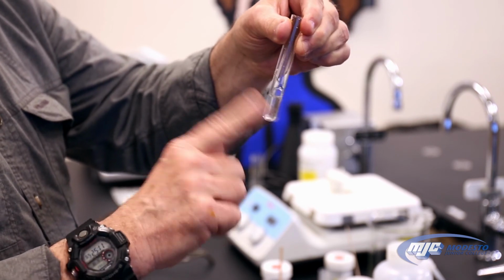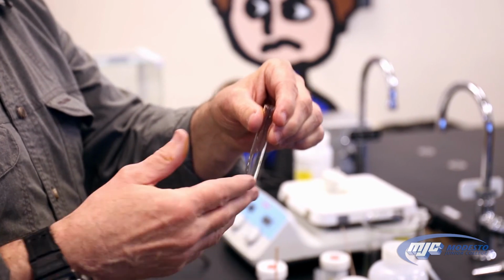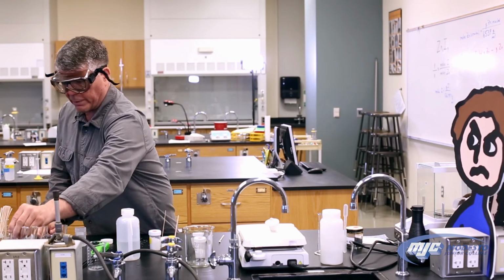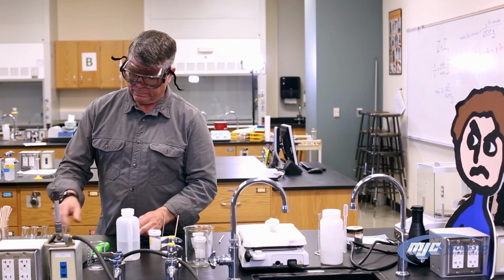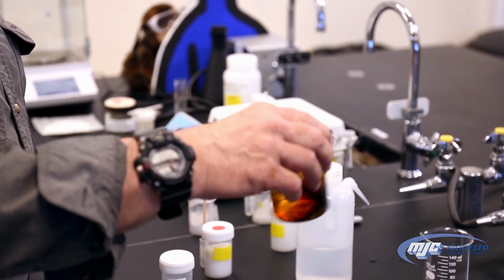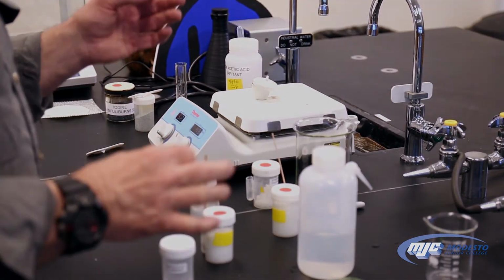If you can see, there's some bubbles coming up. That's a side reaction. Magnesium reacts with water. We don't care about that. So we're going to set this aside, and we'll come back. We'll look at that a little bit later. Let's check in on our zinc iodide. Still dark, so still have a ways to go. Let that finish reacting. Our hydrate's heating up. Now we just have to wait a few minutes.